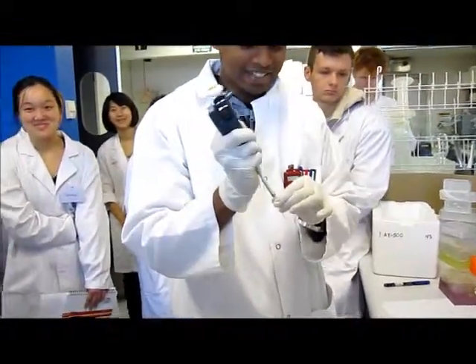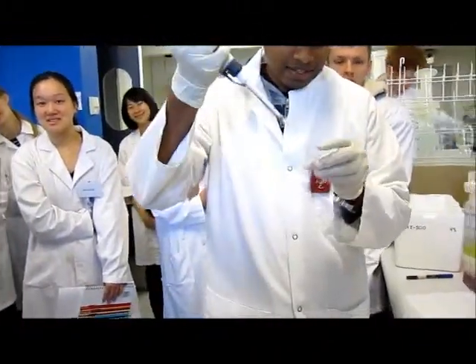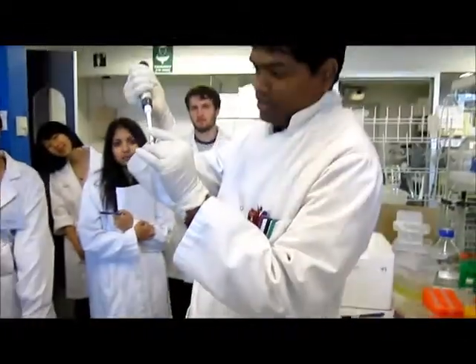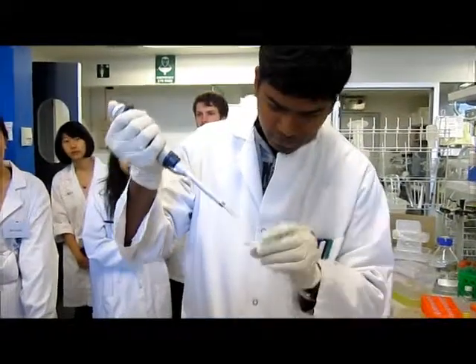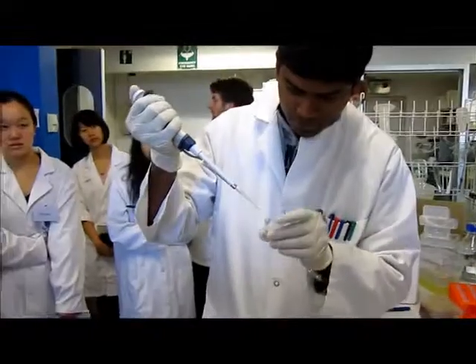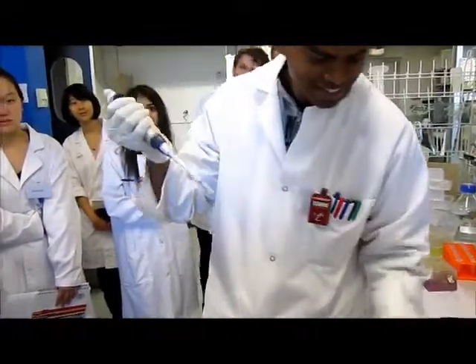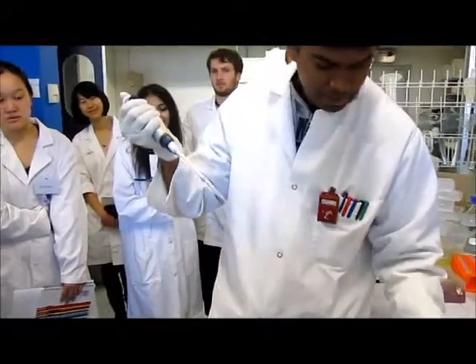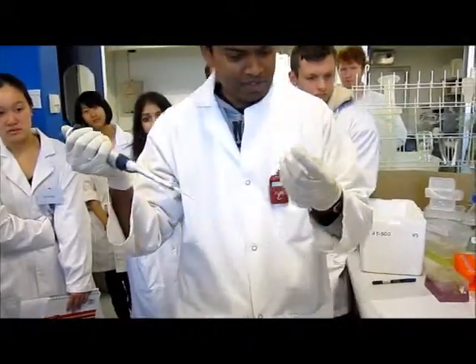Should the drops count? Yeah, micro drops, it adds up. So before that I like to mix. Eventually we have to mix them. Do you guys get my point? Like what and why am I doing this? Because we don't have enough restriction enzyme at this point. I just realized. I thought it would be enough, but it's just not enough.